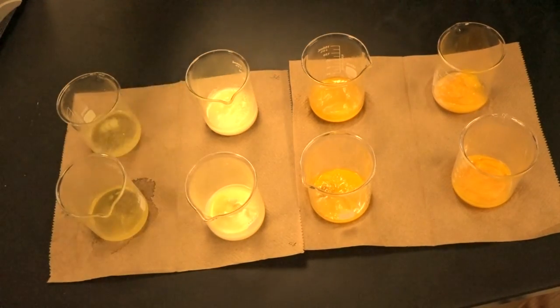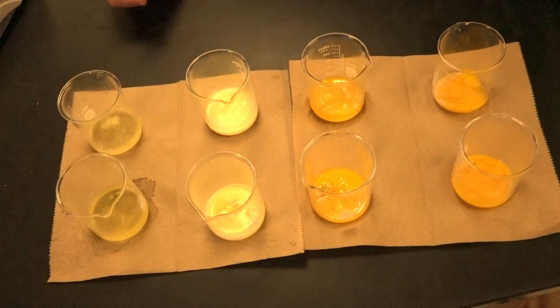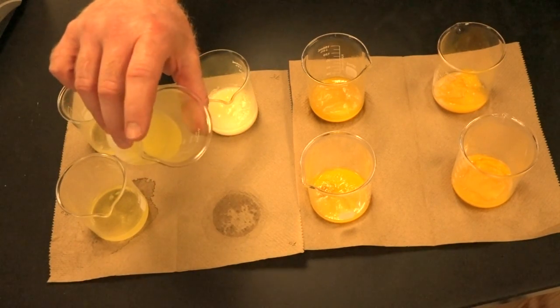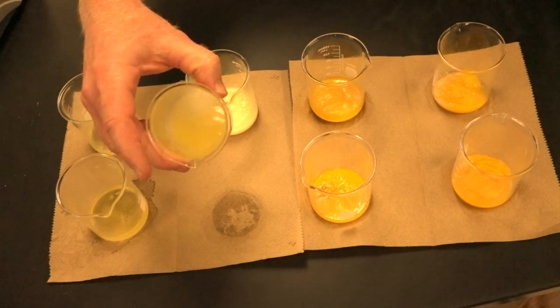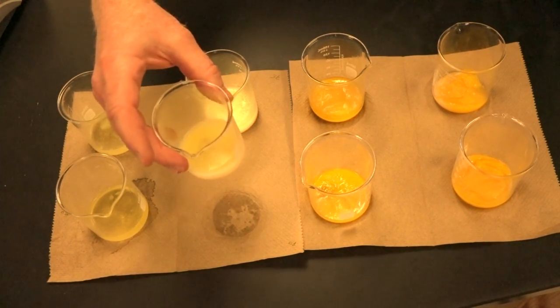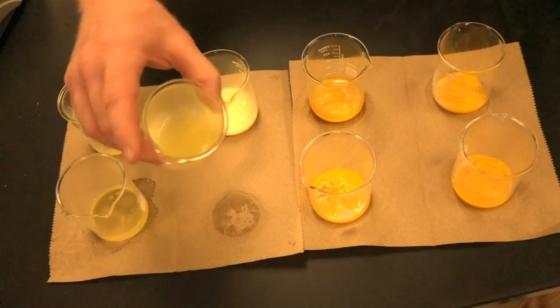And then again, with the texture of it, most of it is liquid, but a little of it is turning into maybe that semi-solid at that point. All right, let's move on to 70°C. Here's 70. Again, you can see now that we've got a lot of denaturation of the proteins going on there. The heat didn't transfer all the way through, of course, because of the way we're cooking this egg, in this beaker, and we just don't have the complete heat transfer instantaneously that we would like to, but you definitely see now that at this point we've got good denaturation happening all along the sides.